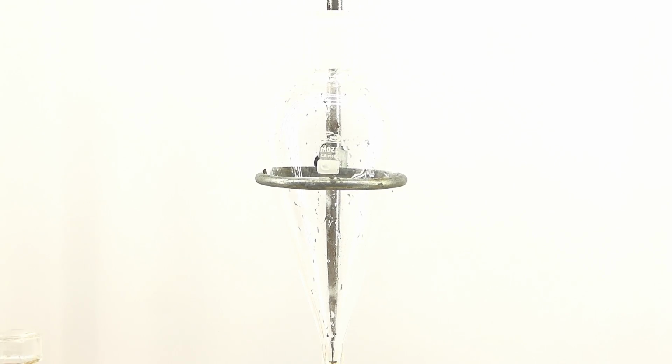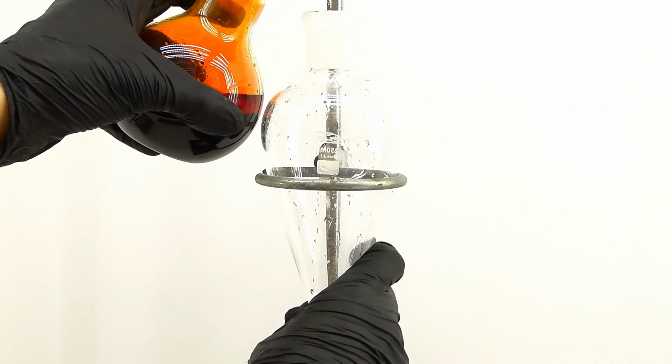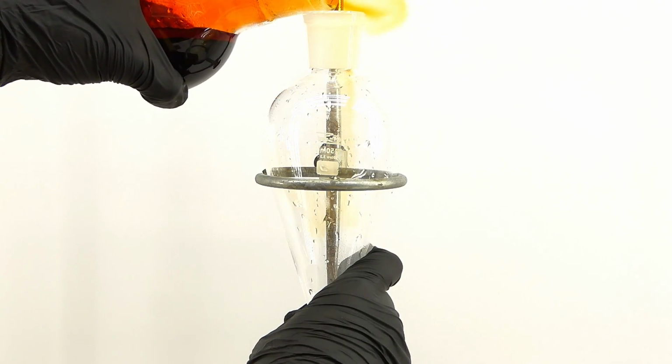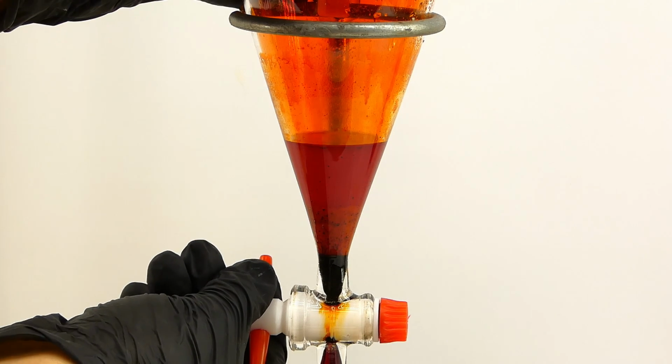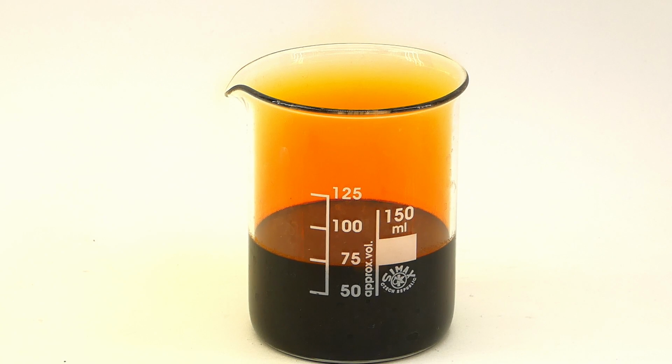To clean it up, I first have to remove the upper water layer, and I can do that using a separatory funnel. After double checking that the valve is closed, I poured in the dirty bromine, which thanks to all the vapor, looked really scary. I then drained it into a beaker and now it looked much better, however it was still a little wet.